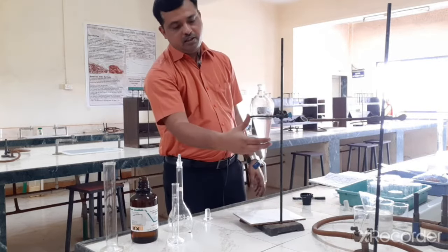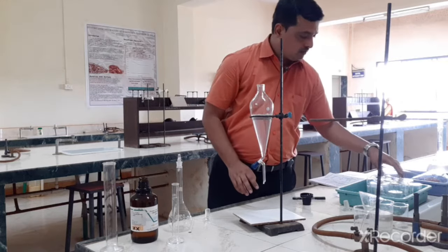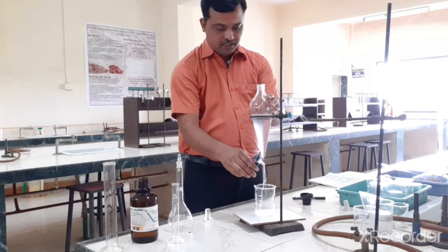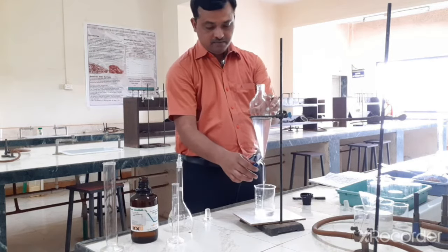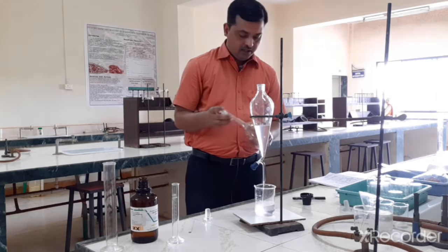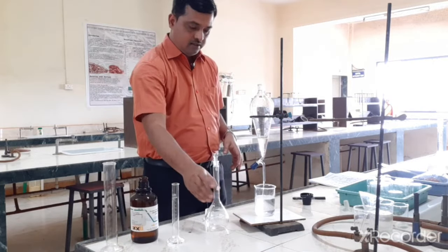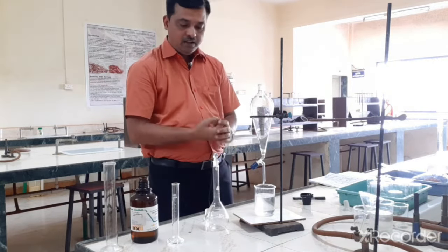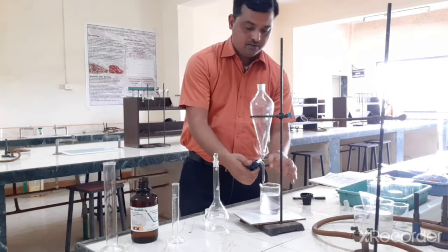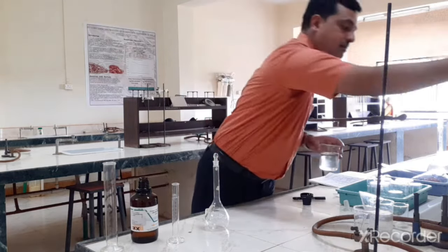Now this is an acetic acid layer which contains the maximum amount of trimethoprim which we have isolated. Now we can take this out in a fresh beaker, and then we need to dilute this. So we are going to dilute in a 250 ml volumetric flask, and this dilution is made again with 1 molar acetic acid. So this is done. I will keep it aside.